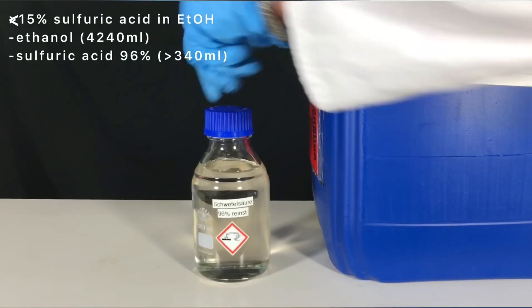Welcome back everyone. The sulfuric acid ban in Europe is approaching, and therefore we are going to prepare 15% solutions of sulfuric acid in different mediums.